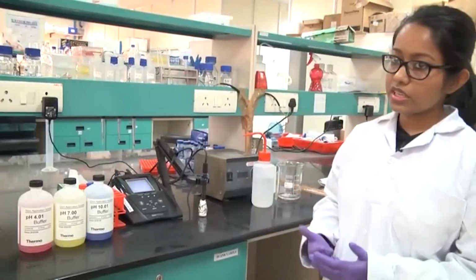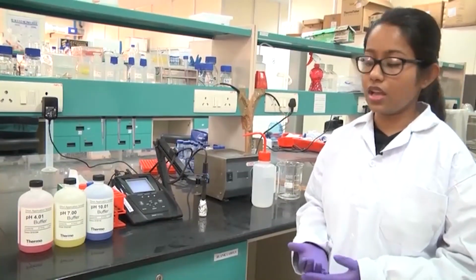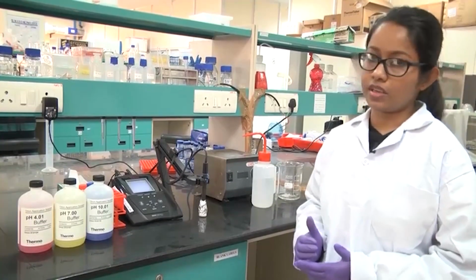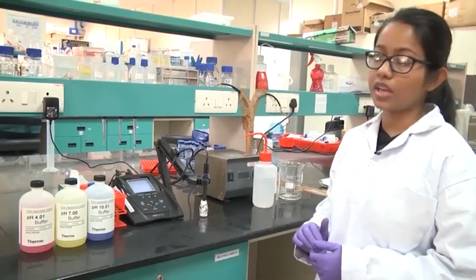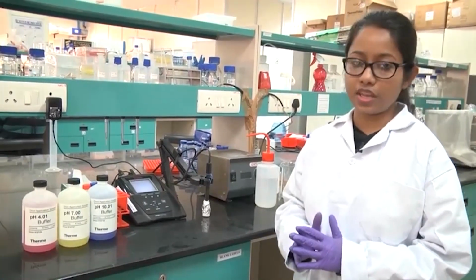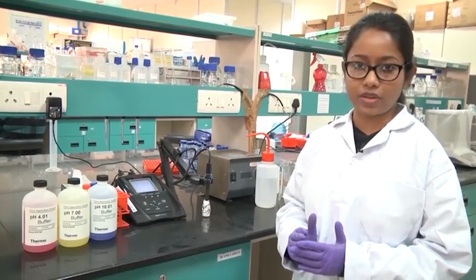Now before we start measuring the pH of a particular solution or experiment, you should always know if the pH meter is properly calibrated or not. At regular intervals, all instruments should be cleaned and calibrated, otherwise accurate pH will not be shown. So right now I will show how to calibrate your pH meter using 3 different solutions, and this is known as the 3-point calibration method.